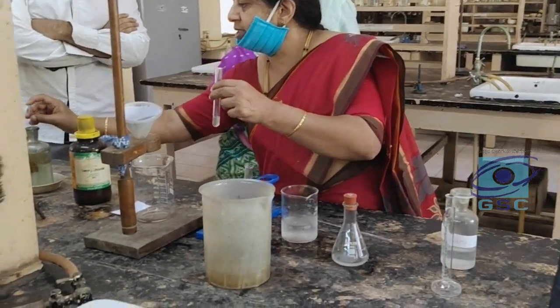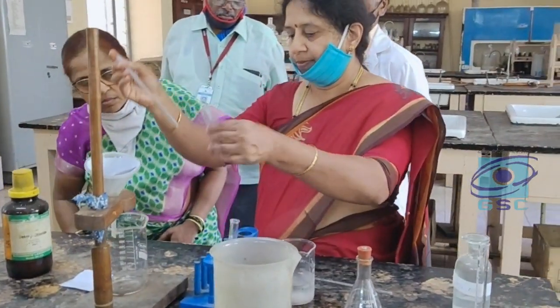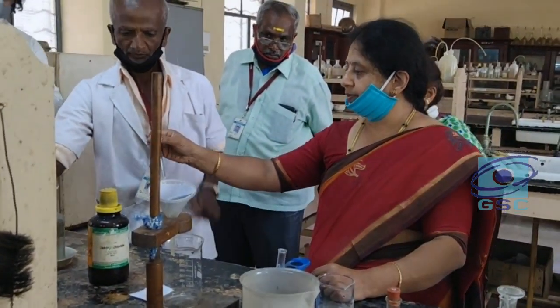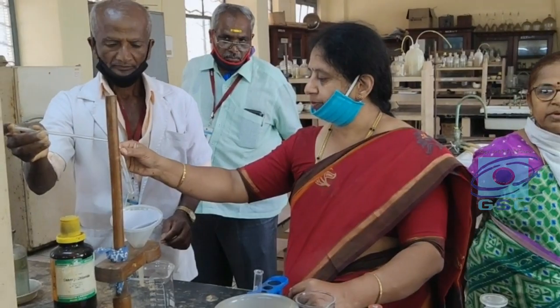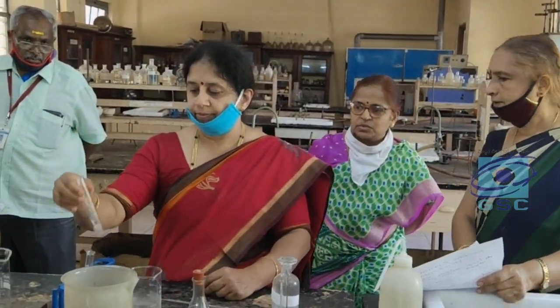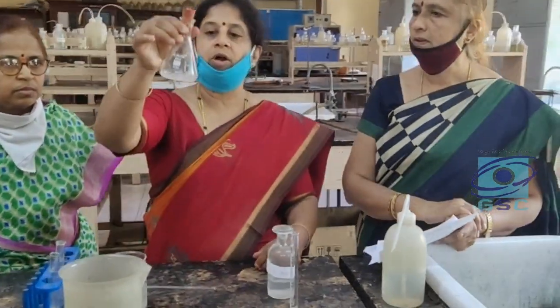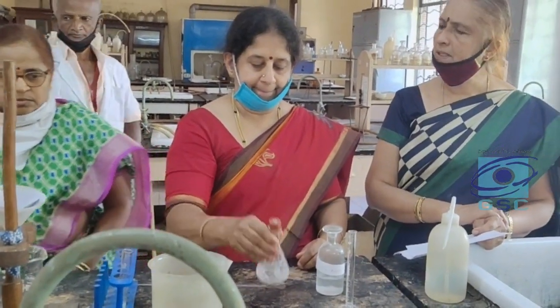I will add acid to make it acidic, because we have done the reaction in sodium hydroxide solution. We have to shake thoroughly — almost it has to dissolve. It should not have any oily drops. Should we keep it aside for some time? No, we have to continuously shake it.